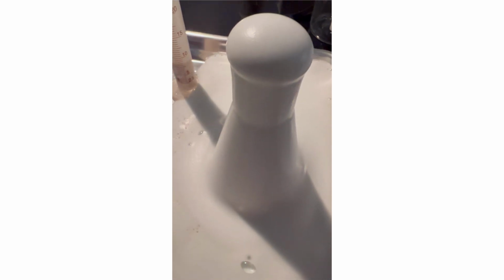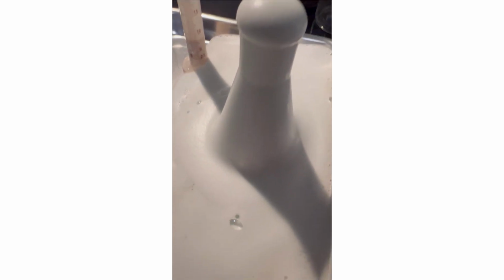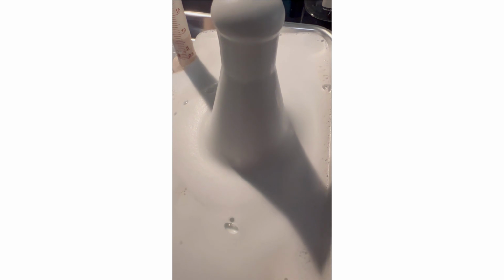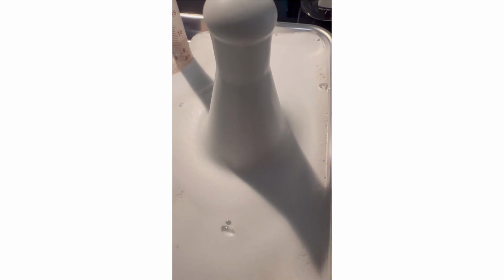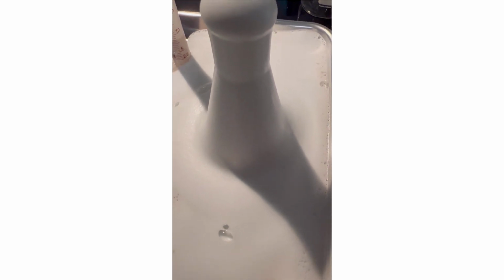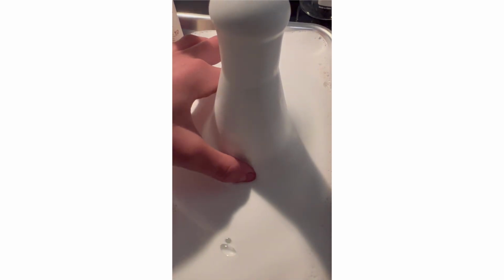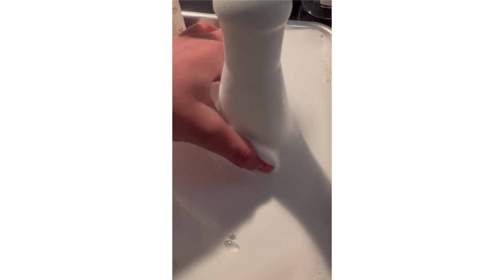And I think why this happened is because, well, the foam is warm-ish. Well, it's room temperature. Pretty sure it's because of the reaction. It releases some heat, which heats up the foam before it exited the container. And why I think the vial is still cold is because it hasn't fully reacted yet. But also, yeah, now it's kind of room temperature.